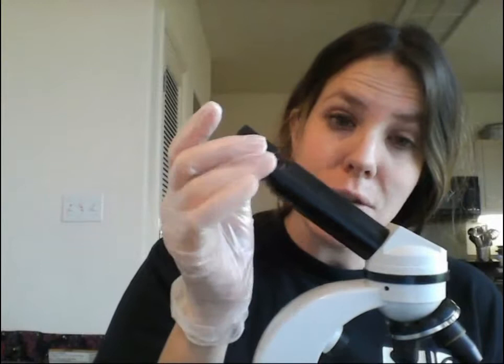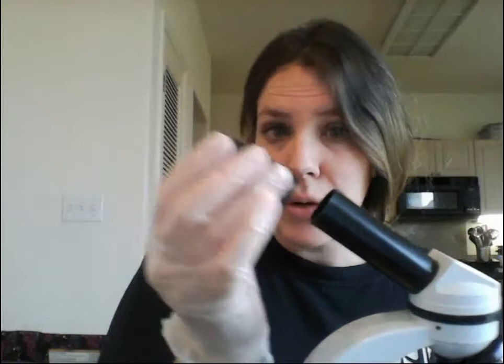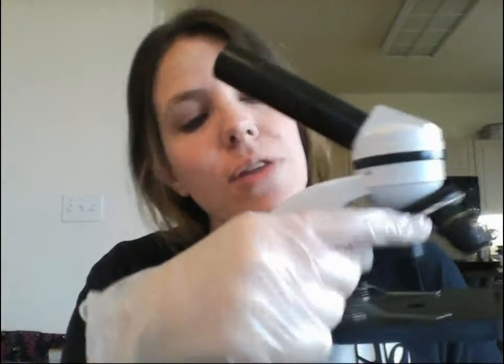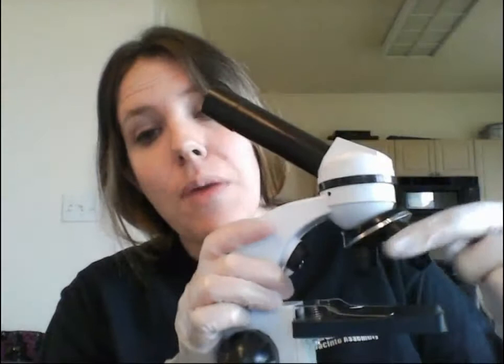This is the ocular tube, and this is the ocular piece or eyepiece. It comes out, so be very careful because it can drop and break. This is the head of the microscope — it's kind of a seam between the ocular and the nosepiece, which holds the objective lenses. These are called objective lenses; they're the actual lenses that will focus on your specimen, and they come at different magnifications.